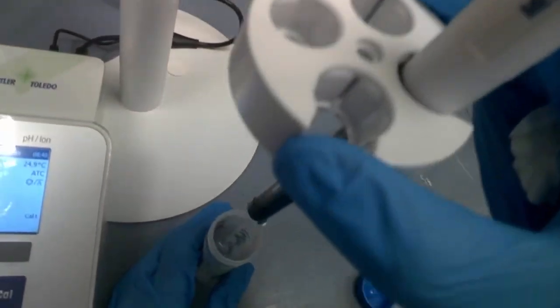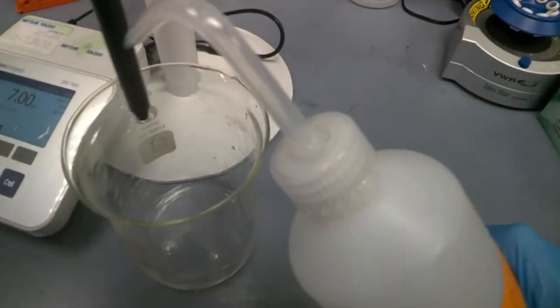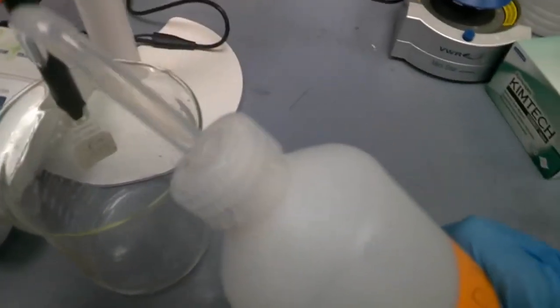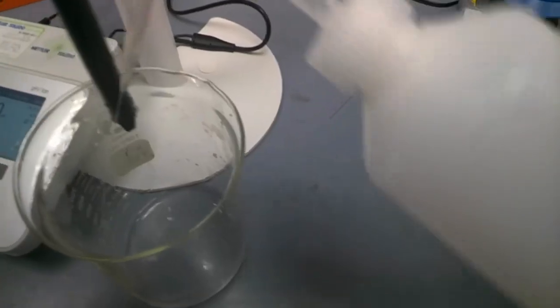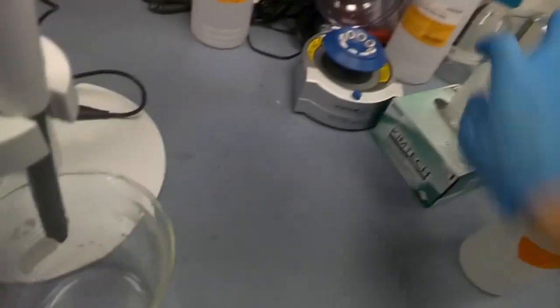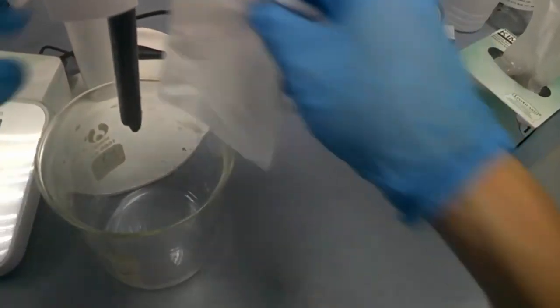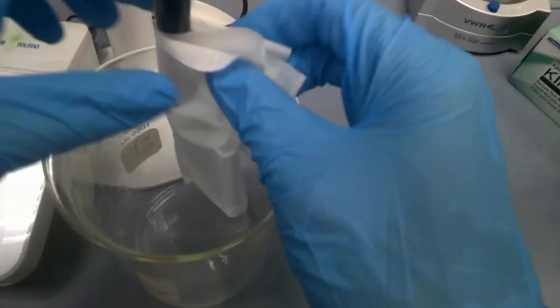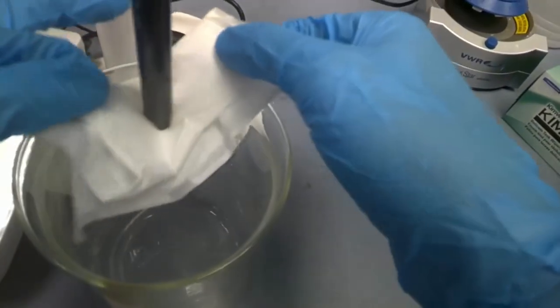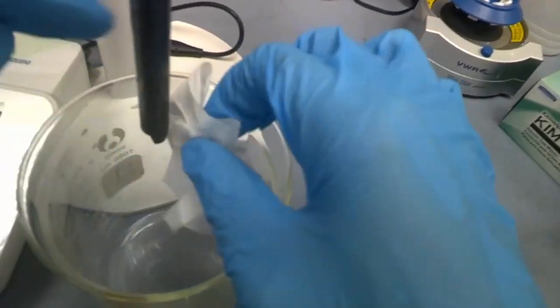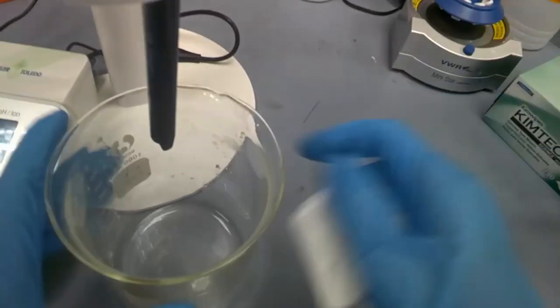So now you lift it up. Cap back your solution, put it back inside the stand. And now, same thing again. You repeat the washing because there's some stains of the previous buffer. Just spray around. And next, use a piece of kim wipe, folding to two. And just wipe around it. Be very careful. Dab on the probe. Do not use too much force. Be very gentle with this.